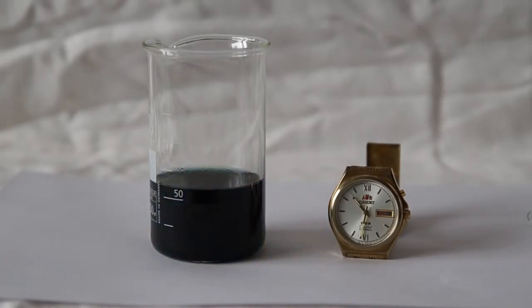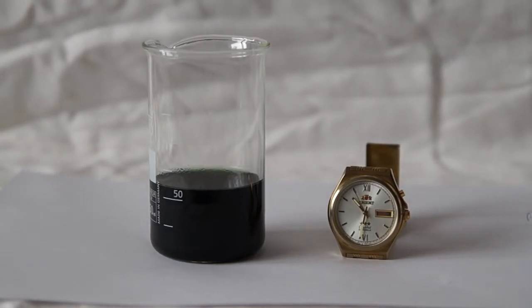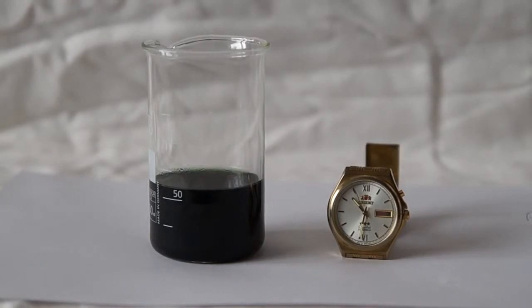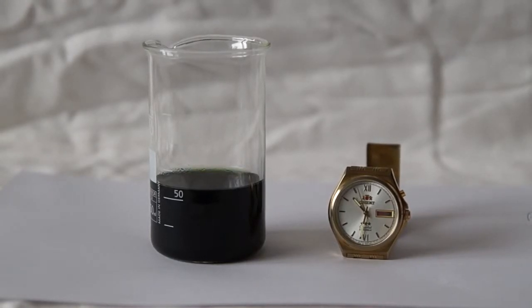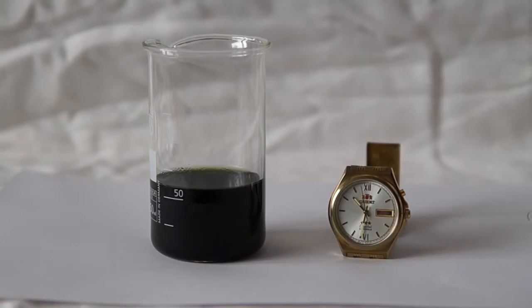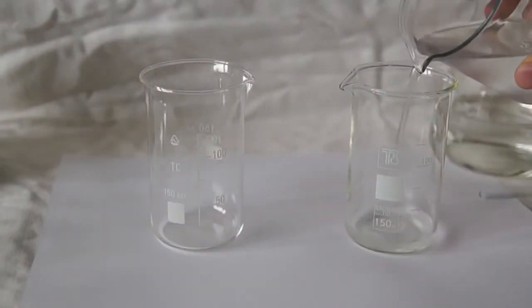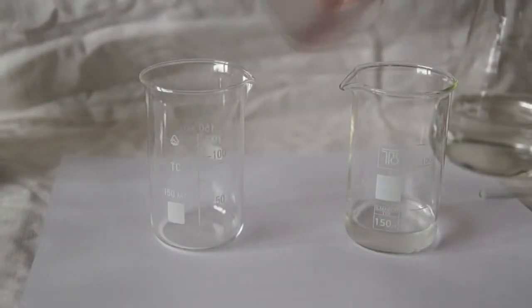The color change is the reaction between iodine and starch — starch acts as an indicator of iodine. Now take two beakers of the first working solution.